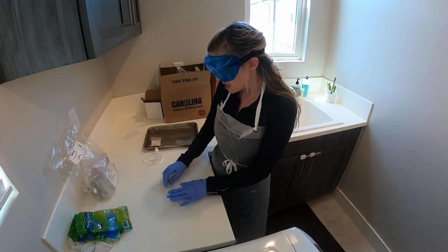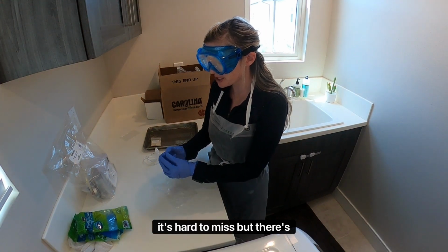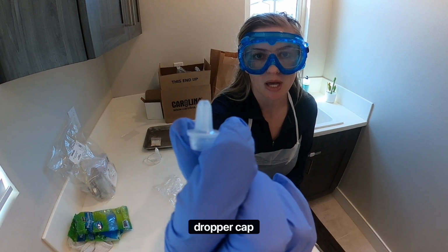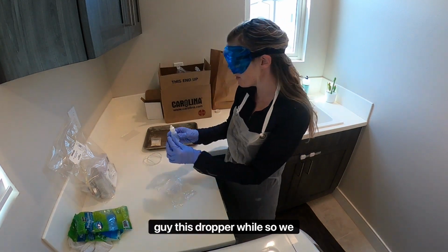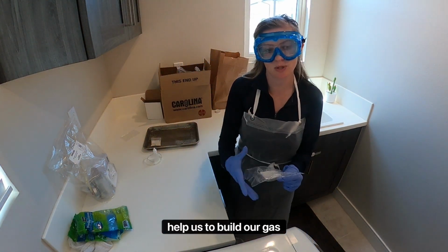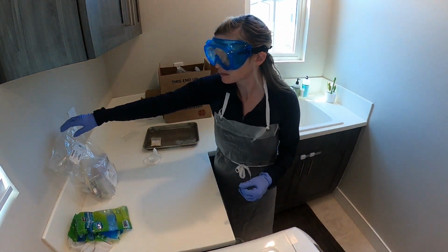The other thing that you're going to find, and be careful, it's hard to miss, is this little plastic dropper cap. That's going to be in that equipment set as well. We're really going to need this. This is going to go with this dropper vial. So we also want to hold on to that because that's going to help us to build our gas collection set.